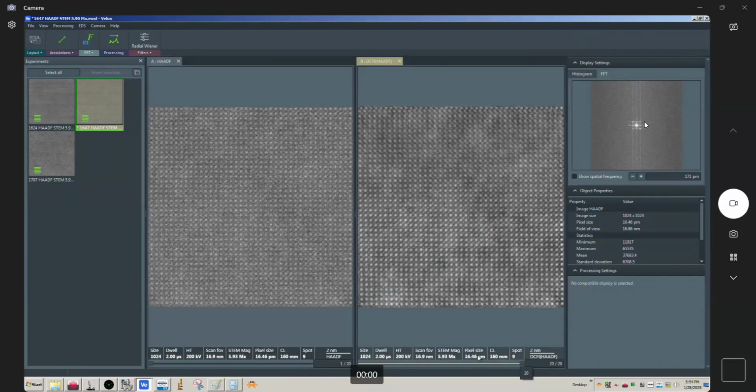So now the question then is, well, what do we do about this, okay? We have to be in the room with the microscope, so that's not an option, right? But what you can do, okay, is that the quicker you can make the time per frame, the less of an issue the instability becomes, okay? So how do you do that? Well, if you drop the pixel resolution down to 512 by 512, keep the dwell time the same, okay? Your time per frame is 1/4 of what it was before. And then it becomes, in this case, 1/2 of a second approximately per frame.